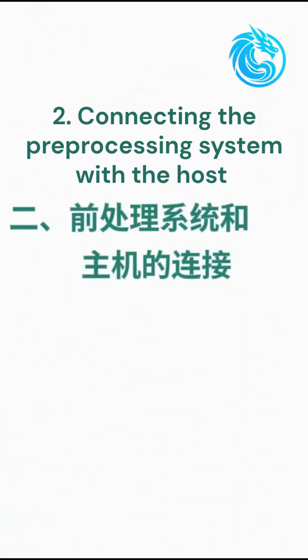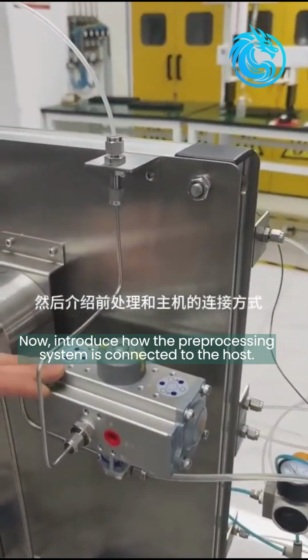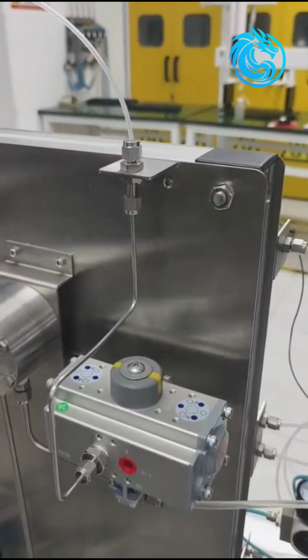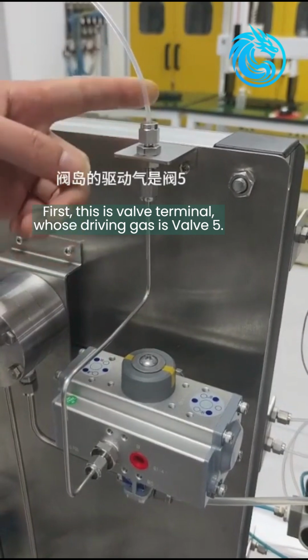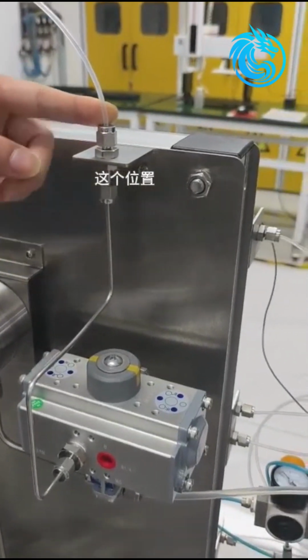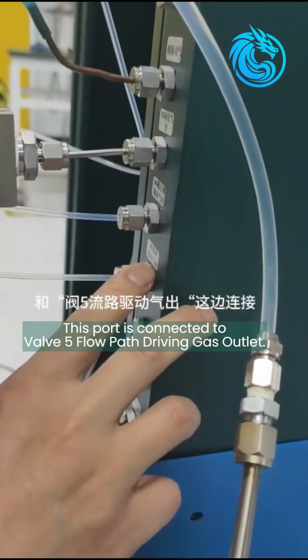Connecting the preprocessing system with the host. Now, let's introduce how the preprocessing system is connected to the host. First, this is the valve terminal, whose driving gas is valve 5. This port is connected to the valve 5 flow path driving gas outlet.